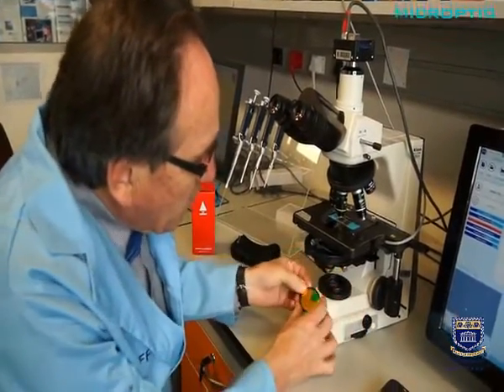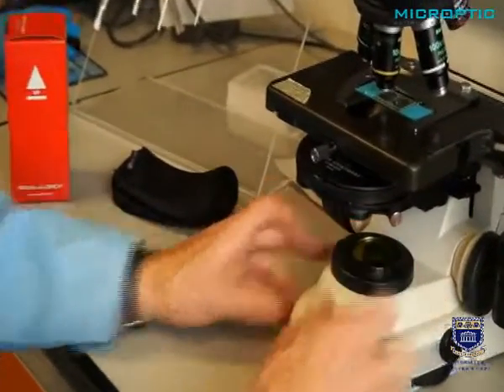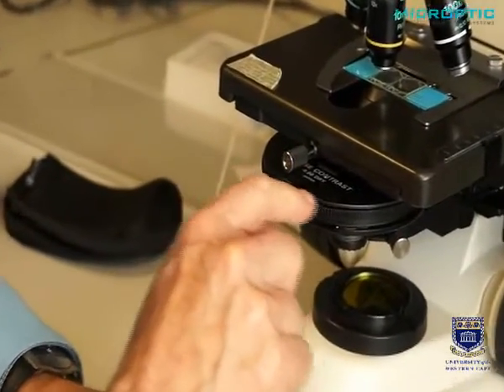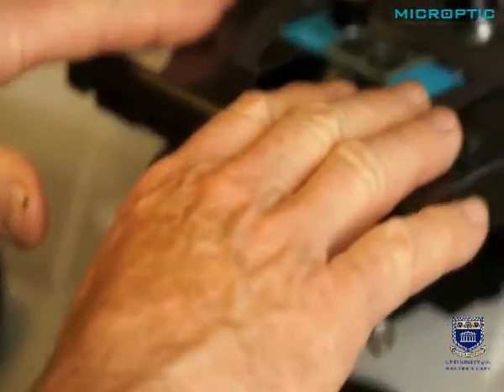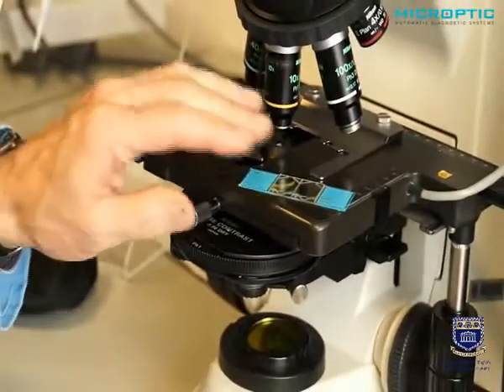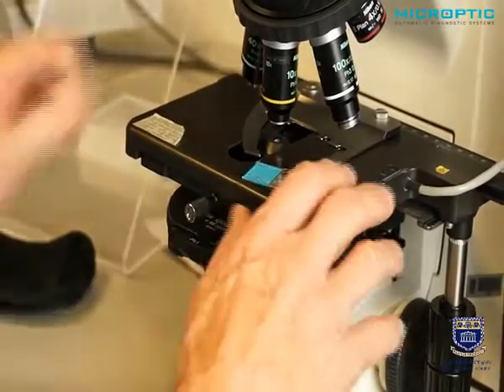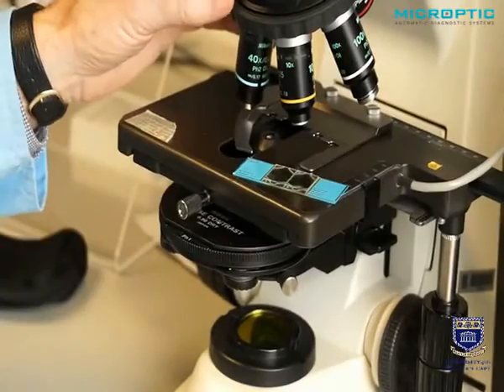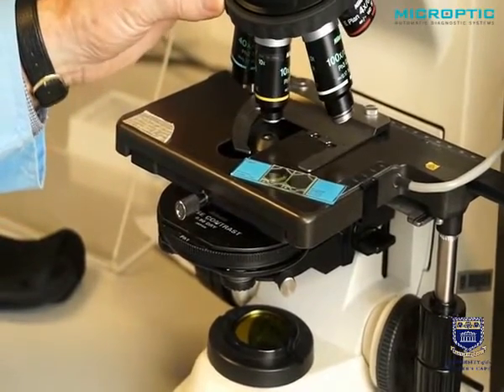It has a green filter, which is essential for positive phase and negative phase contrast microscopy. It has a phase contrast condenser, and then of course I've indicated the heated stage. Before we do any measurements, we heat up the slide here also, and we fill the slide. And here we have a 10 times positive phase lens which is required.